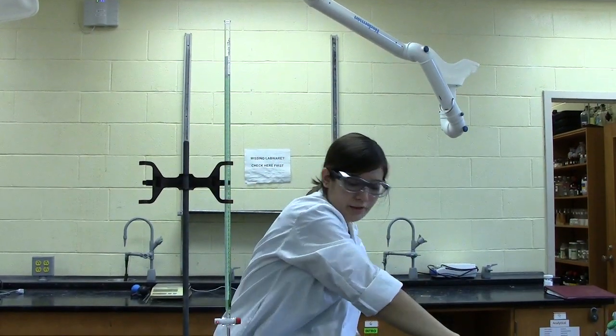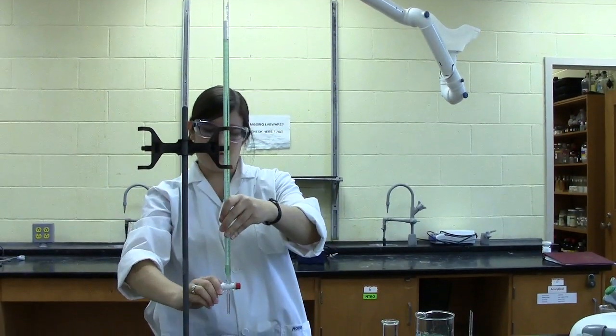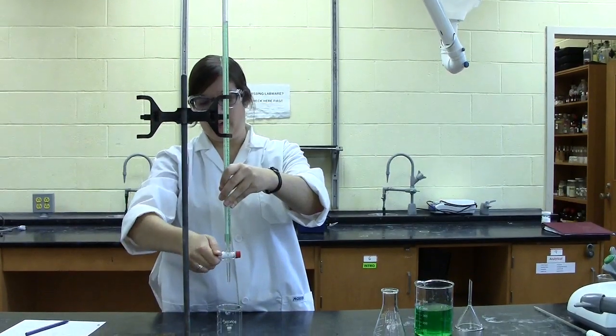Once you have the burette full, make sure that you fill the tip as well by opening the valve and then closing it.